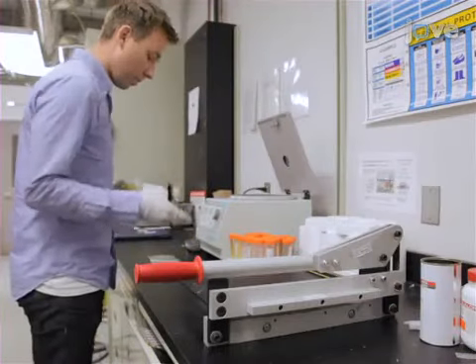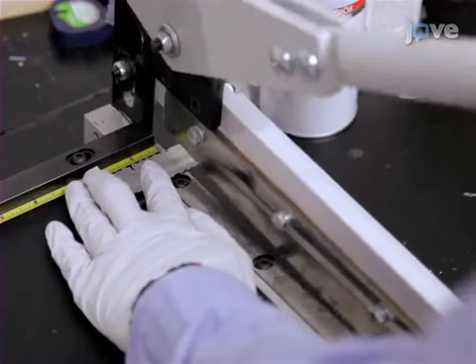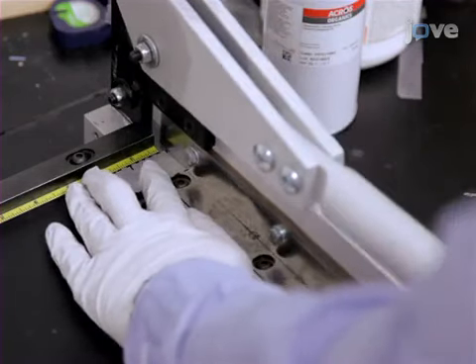First, cut out approximately two centimeter by two centimeter sheets of high purity unpolished aluminum with a thickness of 250 micrometers.